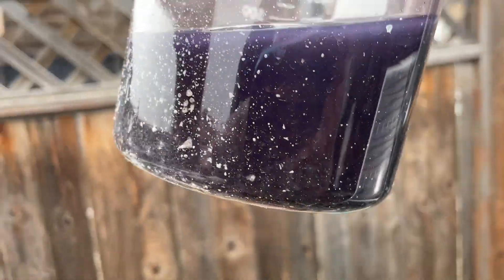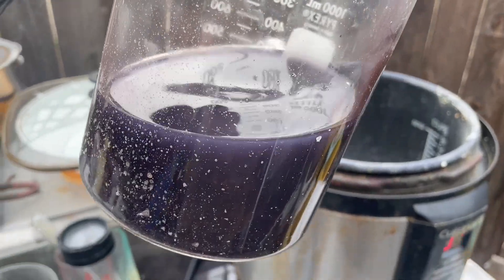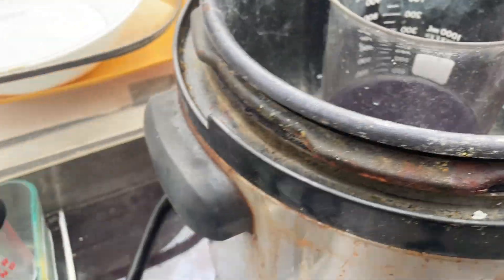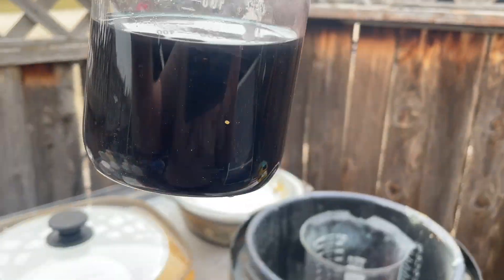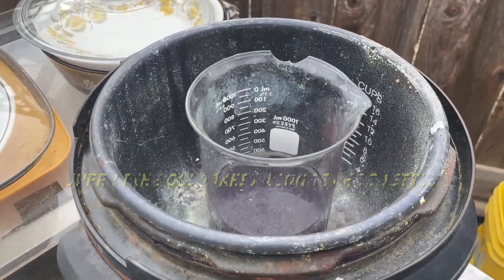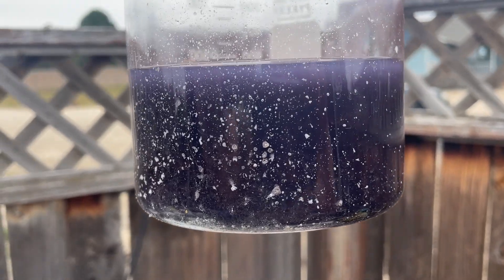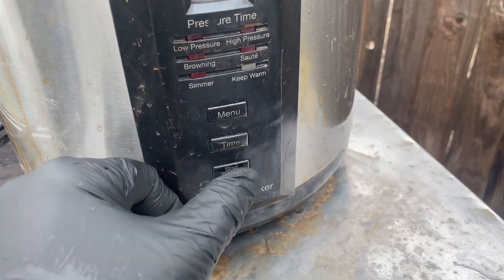This is concentrated about a million times too much, you know. We had all that weight in that material and then basically melted it into a chunk of fine gold. So I poured a lot of it off into here — I'm going to let that settle again and see what we've got. This is primarily water but I'm going to let that settle for a little bit.